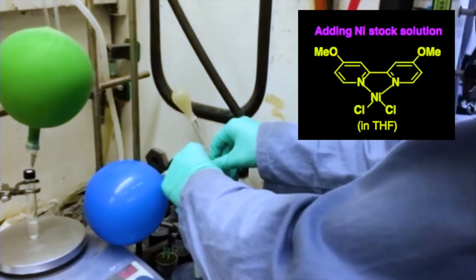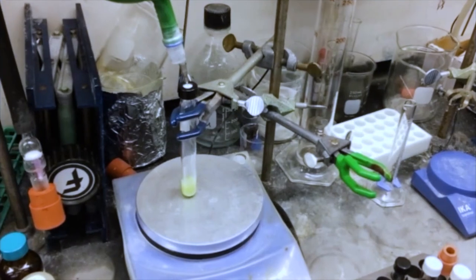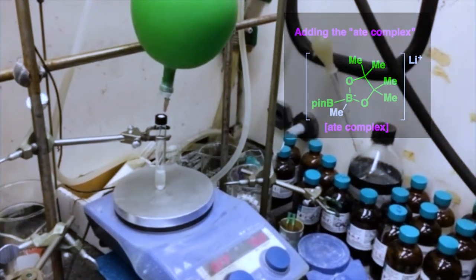Adding our nickel stock solution, and we're going to add the ate complex.